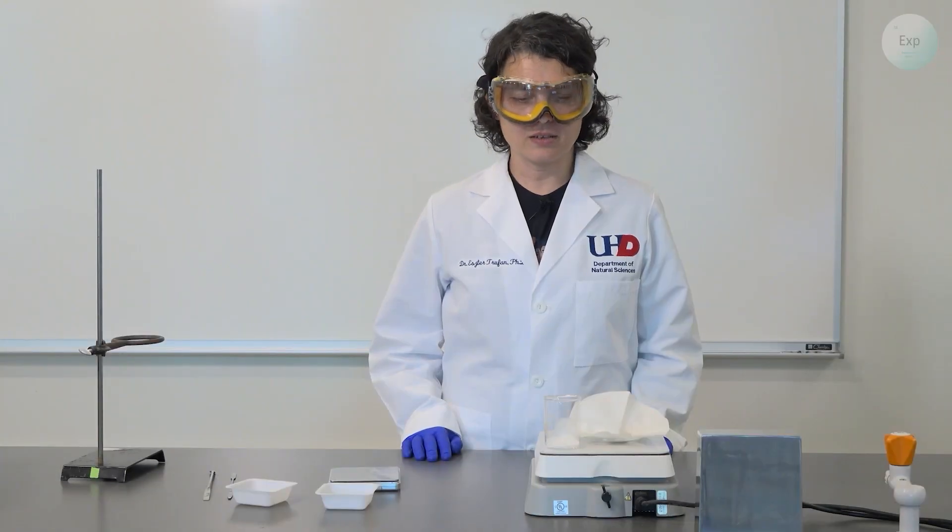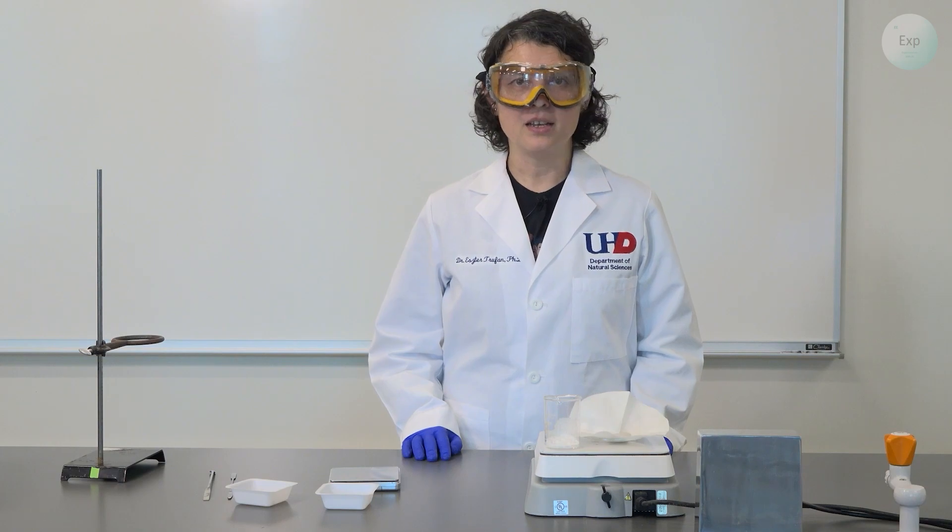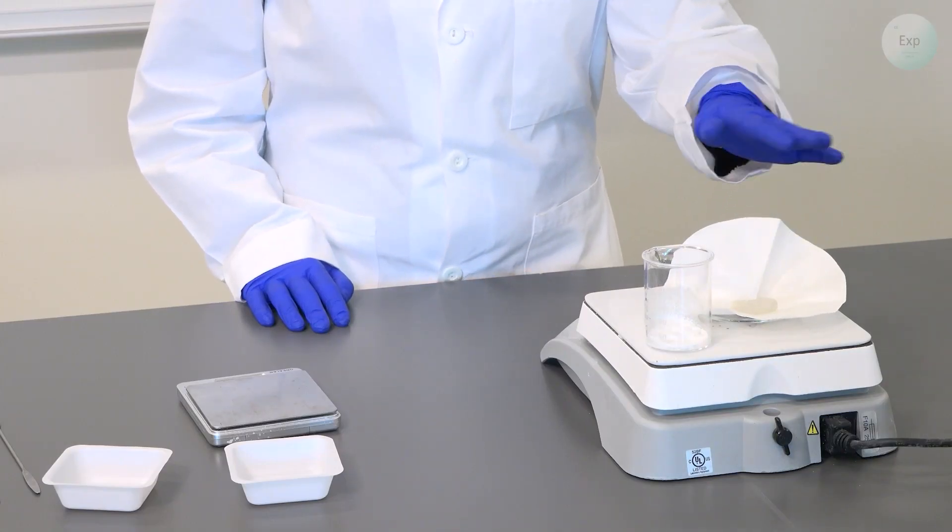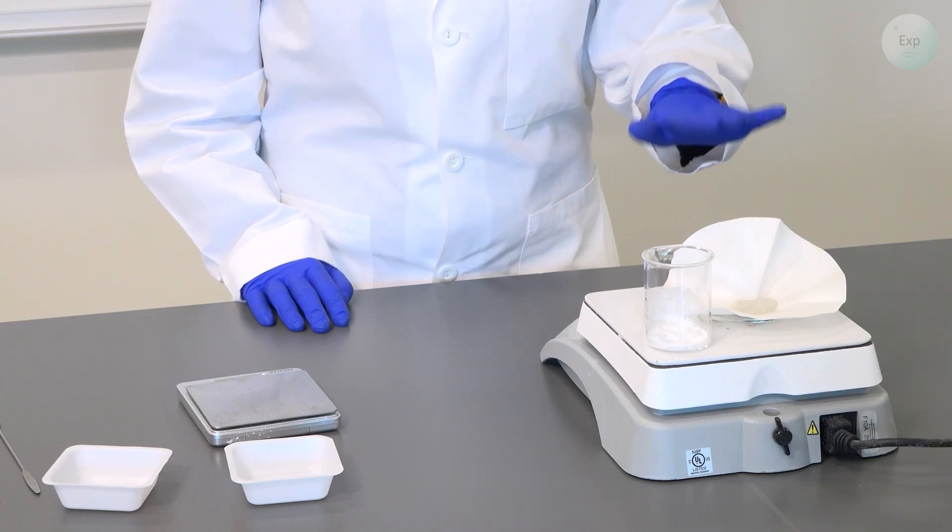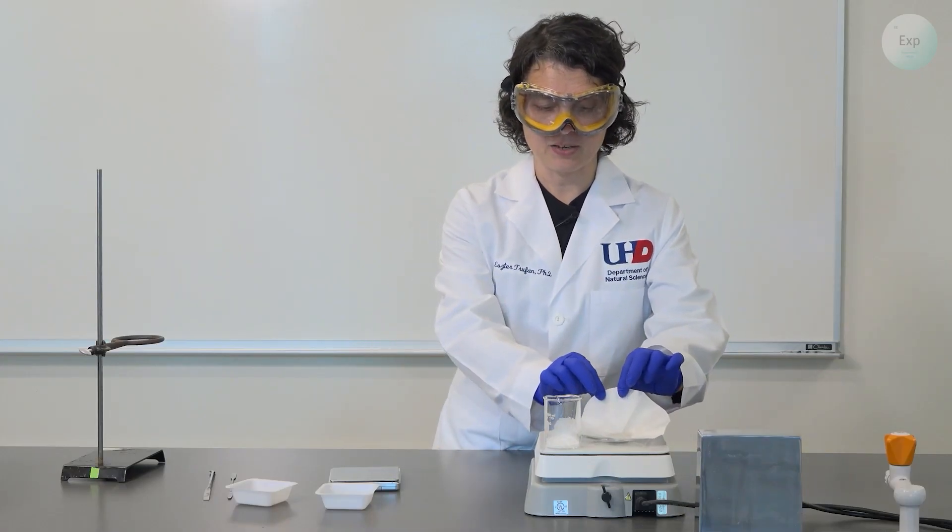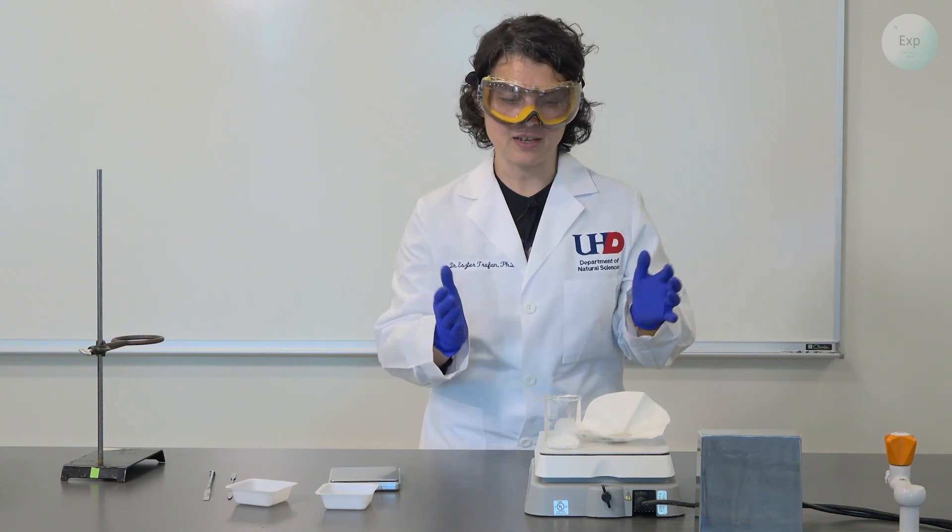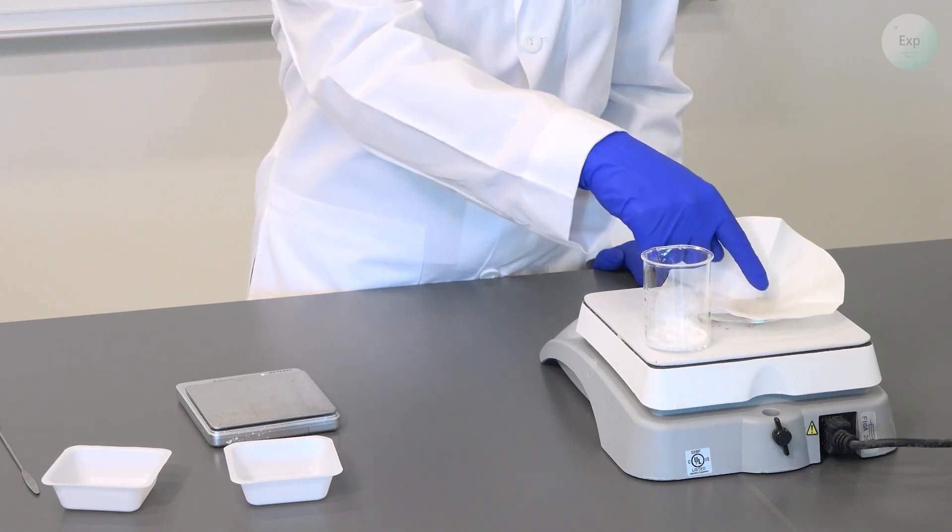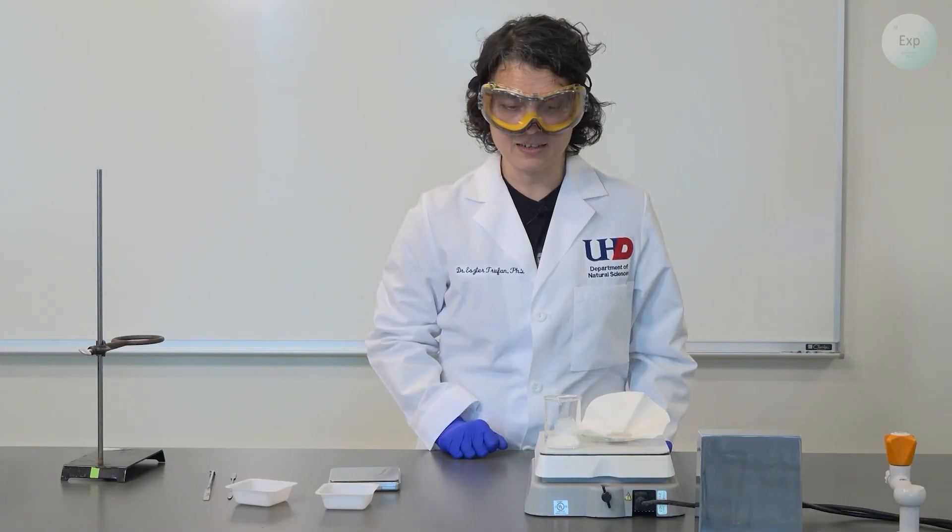It has been approximately 25 minutes since we started the evaporation of water in two different setups. First, we have the filter paper with the wet sand on a watch glass, and that was evaporating slowly. It is dry now, and we can tell because the paper unfolded itself, and the sand is dry within, and you can see it's falling apart and it's sandy.